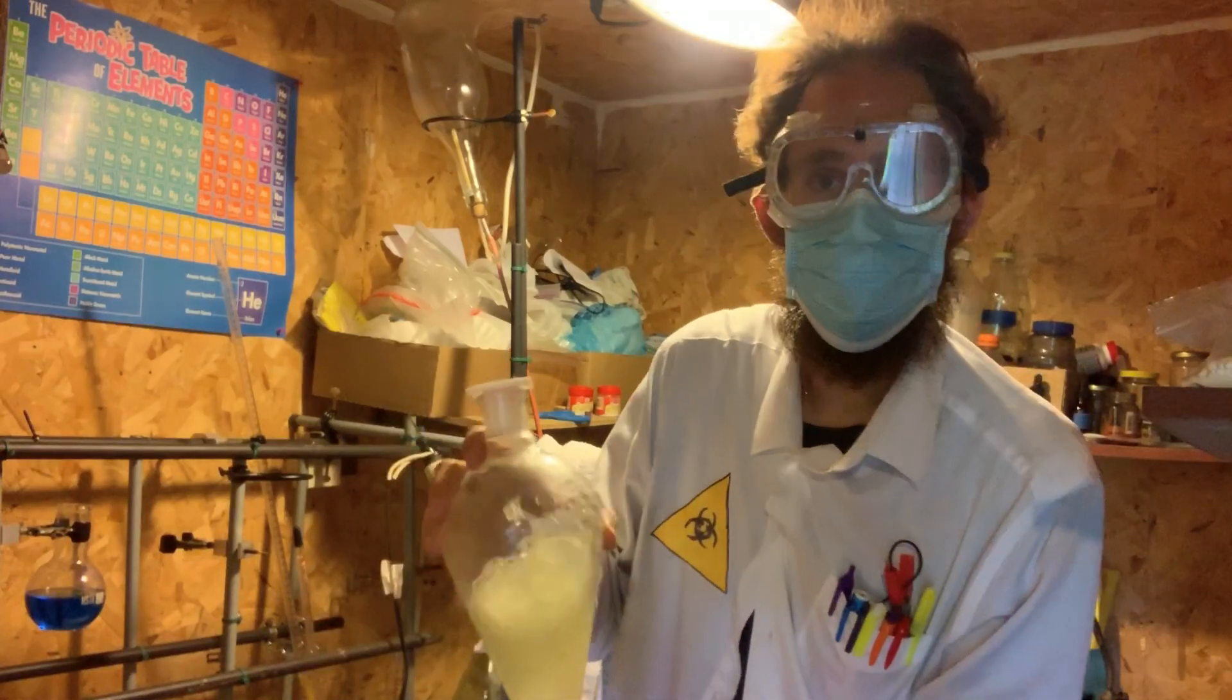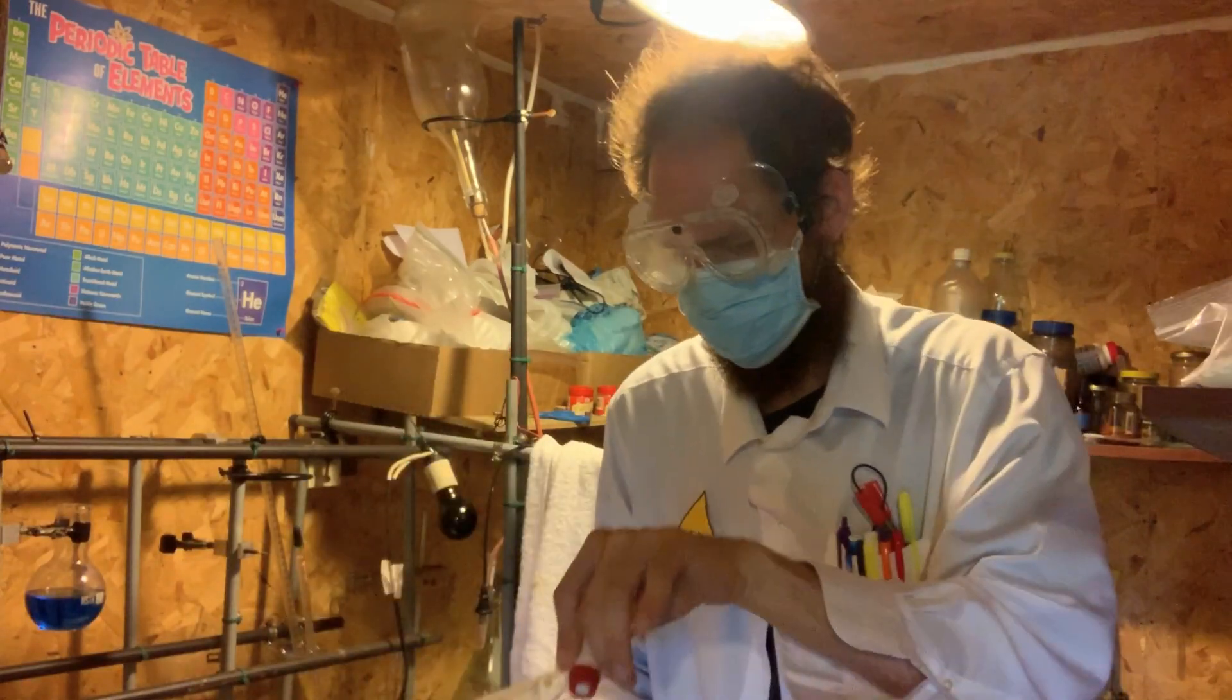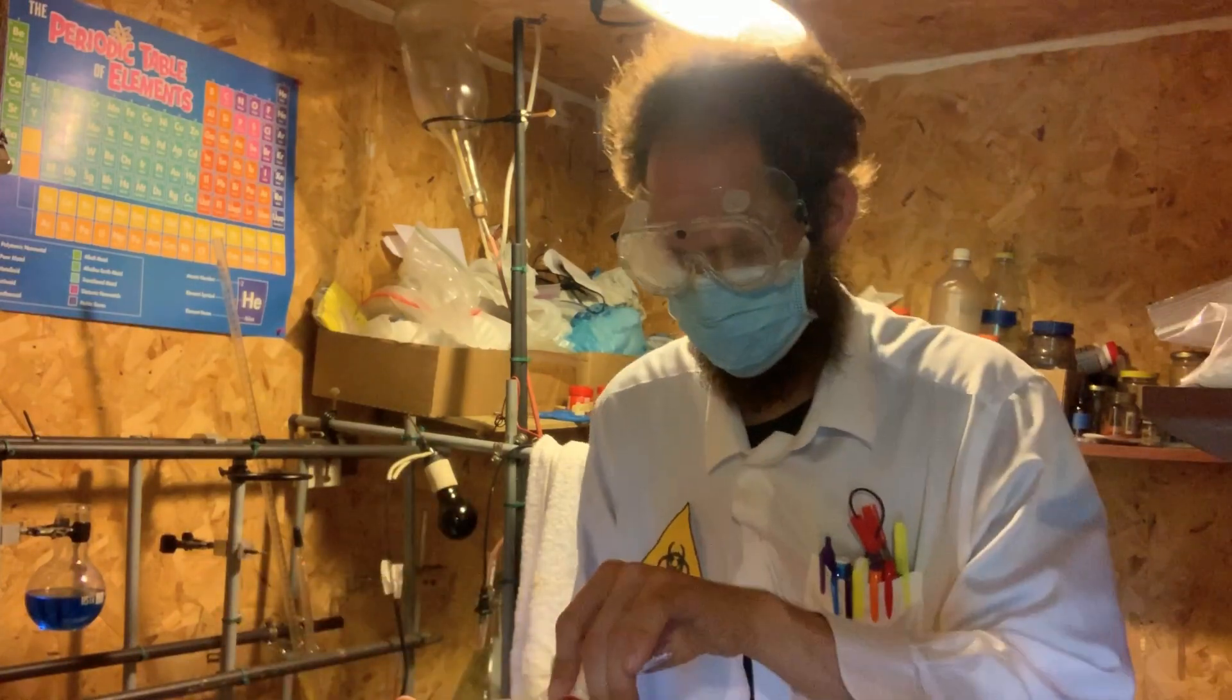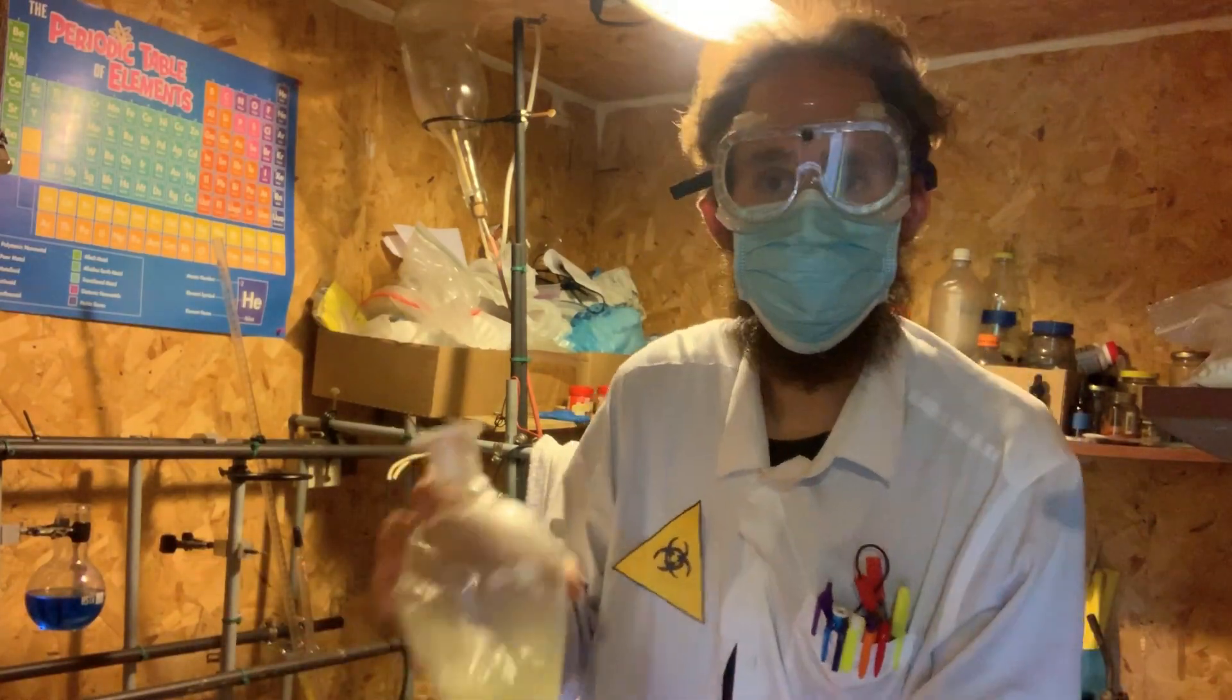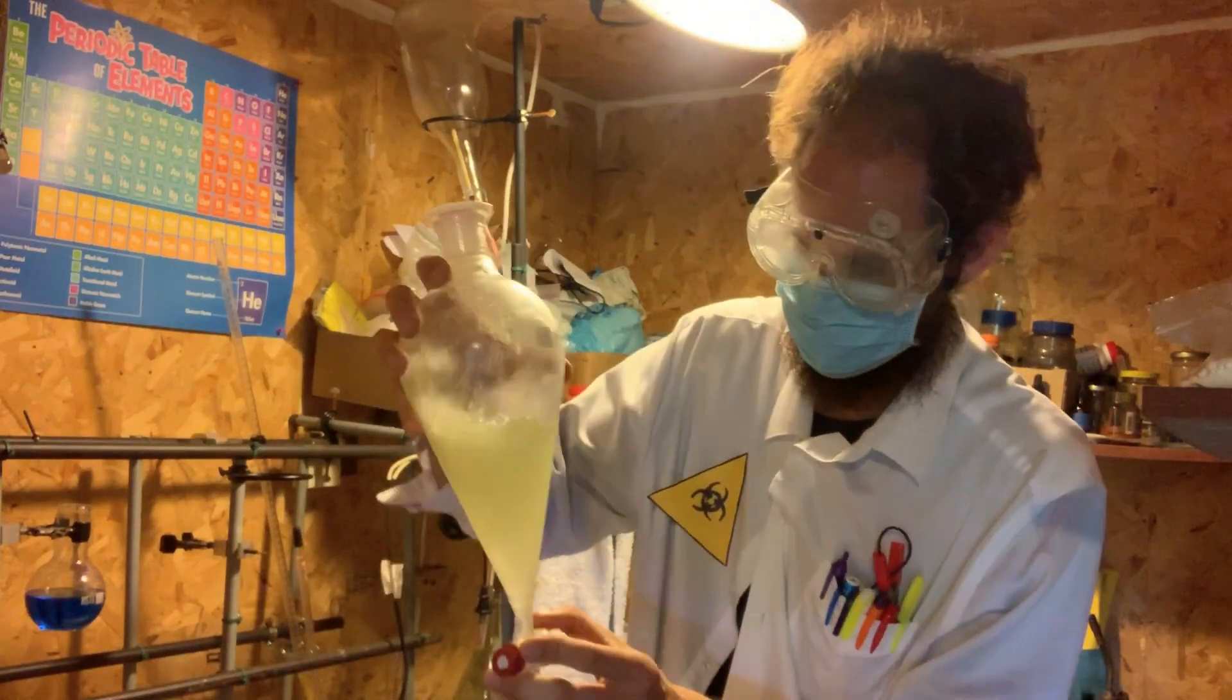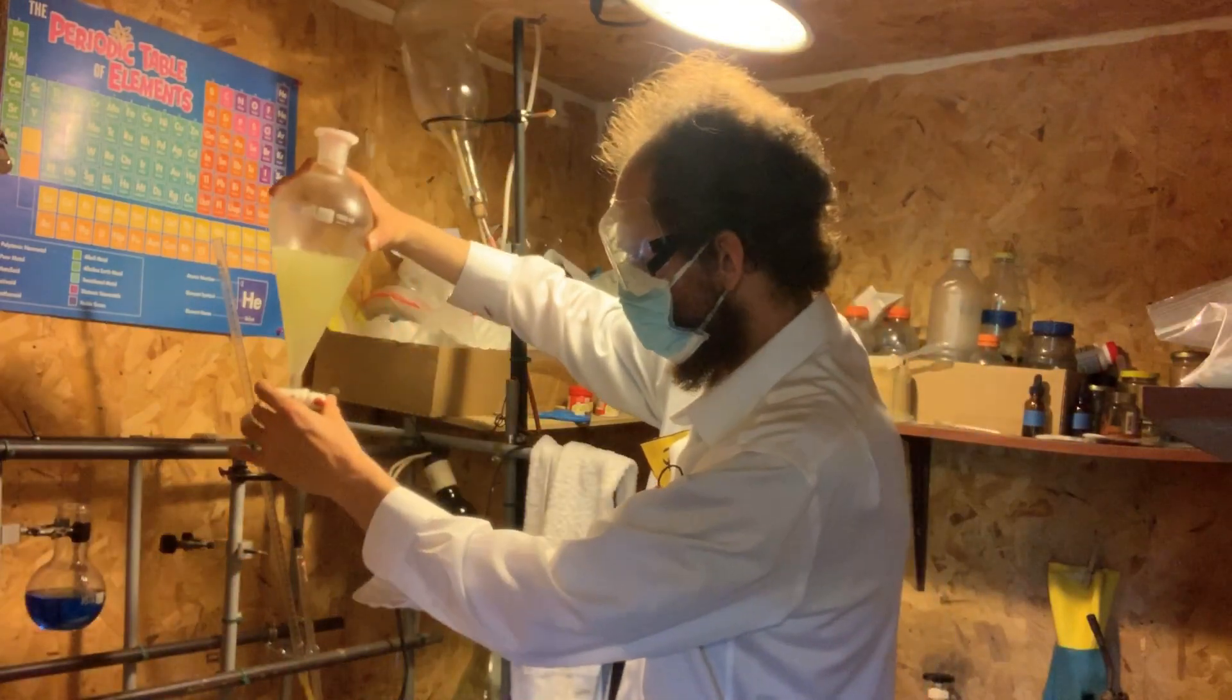Now two layers are going to form here, and the bottom layer is the bromoform. Keep in mind the bromoform is very dense, so it's going to sink to the bottom of the solution. I'm going to let this stand for about an hour or so.